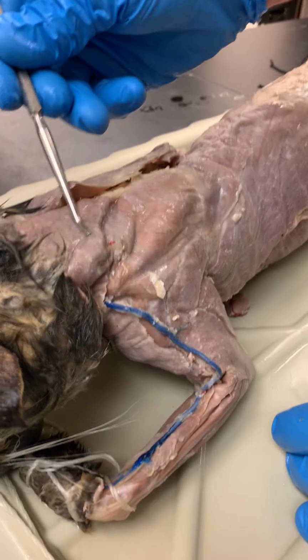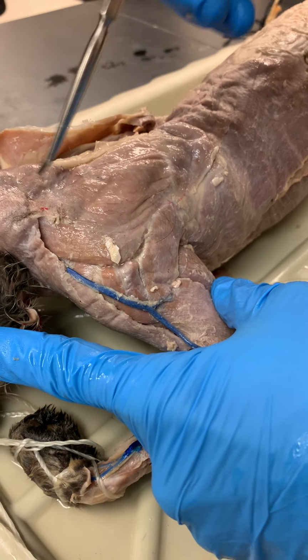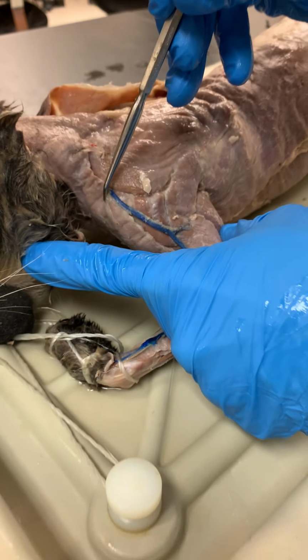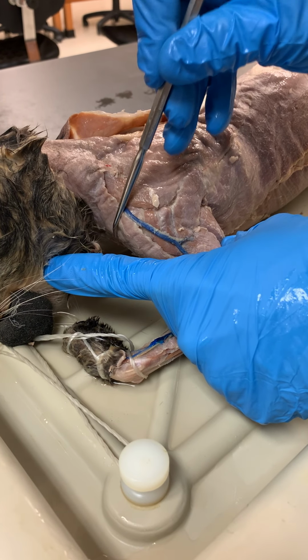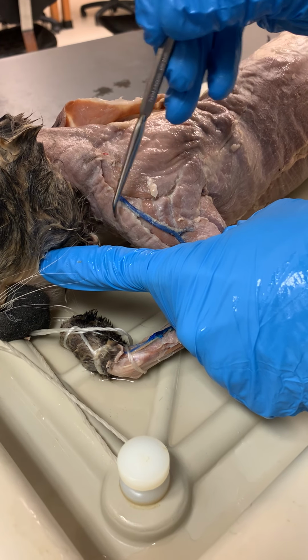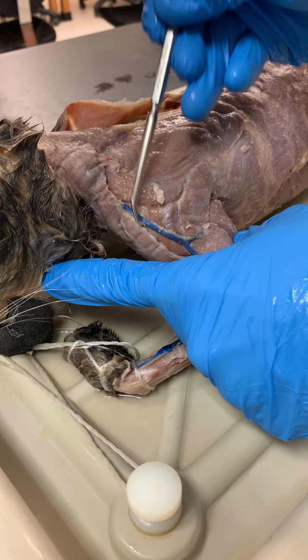Here we have our clavotrapezius. One thing that's a little hard to see here is where the clavotrapezius ends and the clavobrachialis begins. They fuse together right at the clavicle. So we have a little seam here. On the day of the practical, the tag would either be here or here, but not right on the line. So here's our clavobrachialis, again, also called clavodeltoid.